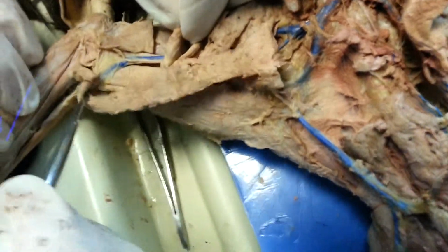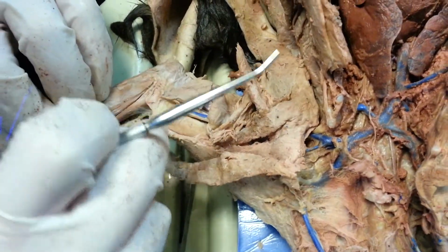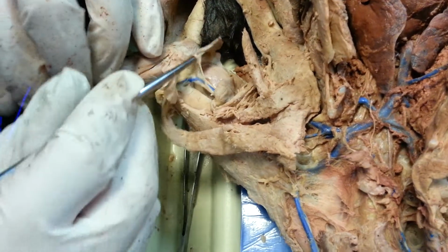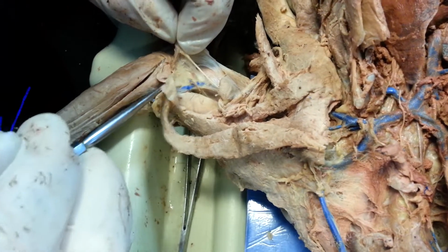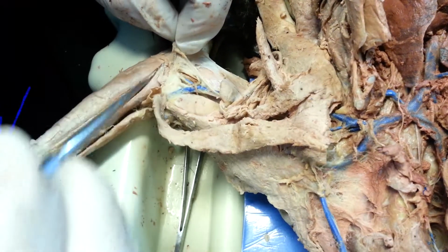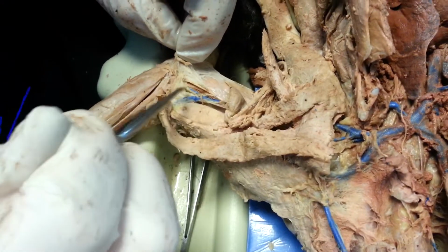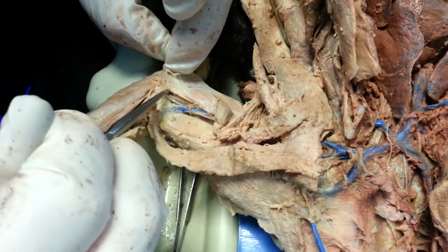Down in here, obviously, we're in the brachial. And then again, let's find the split here, because that's where I had two dissections last year. Actually, you're starting to see the split down there, for the radius and the ulna?